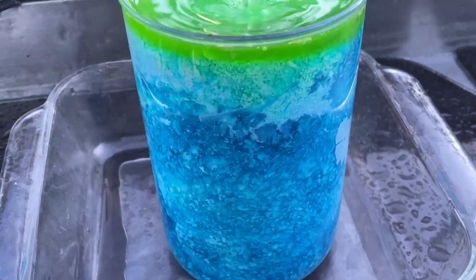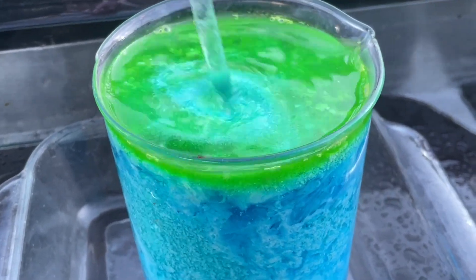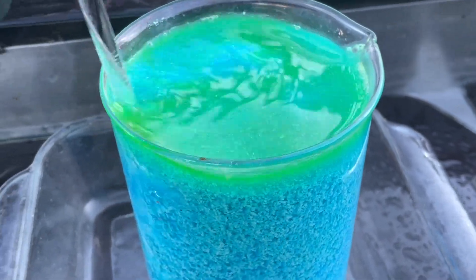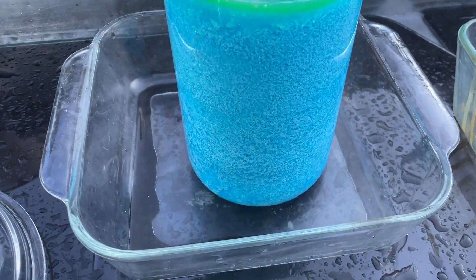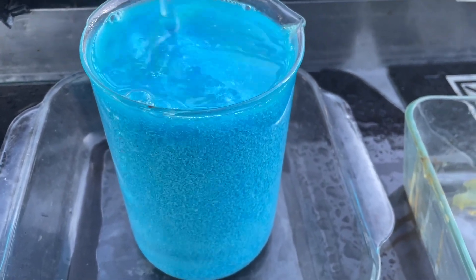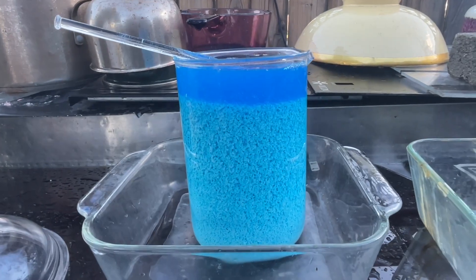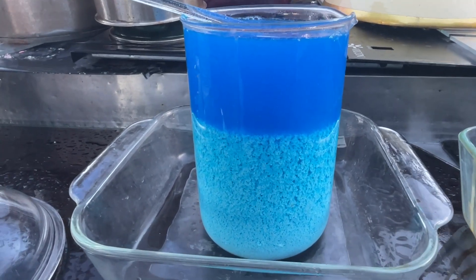Okay, we're going for it now — gonna give it heck. It's got a lot of hydrochloric still sitting on top. We got a fluff of chlorides — a flotation layer of chlorides. We're getting it stirred up. It's mighty full so I can't go crazy. Oh look at that — looking good. We're getting it out; we got it now.